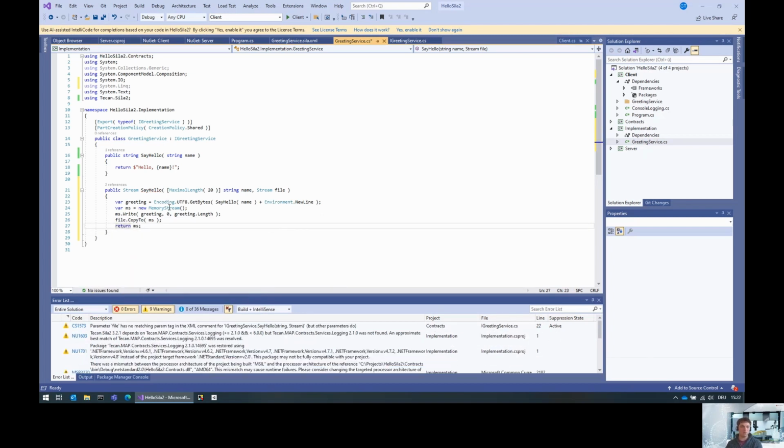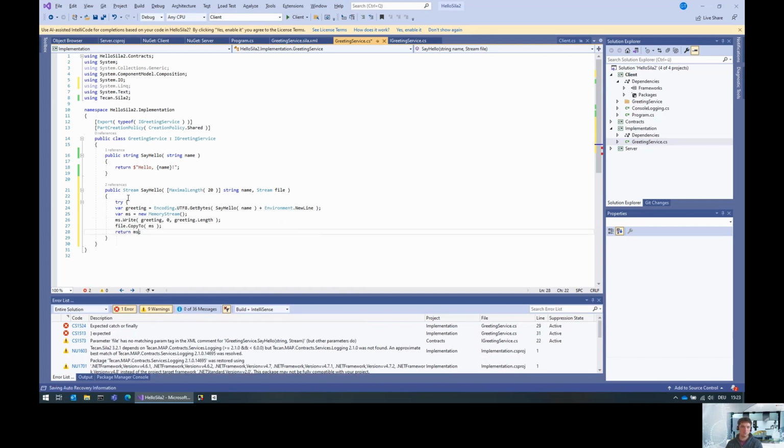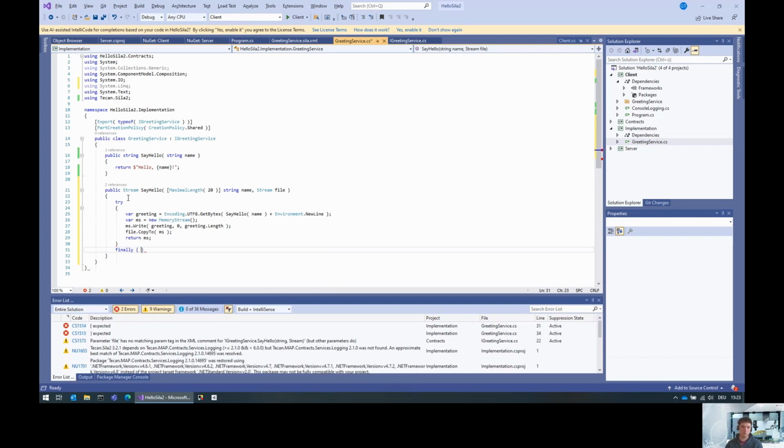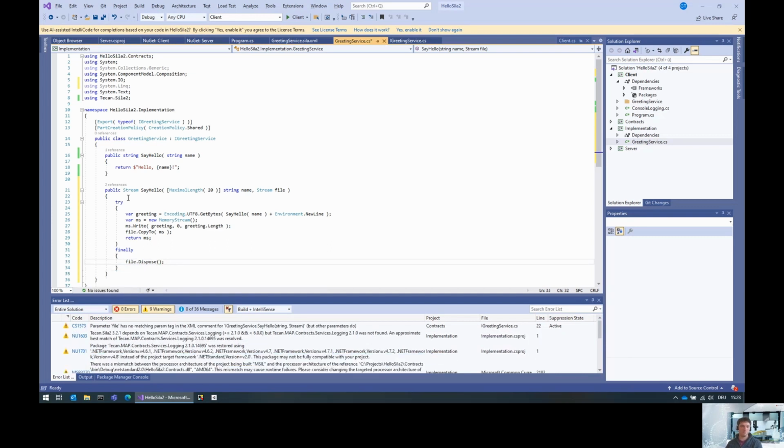Now, who is actually going to take care of this thing? And the answer is we have to do that because the SDK does not automatically clean up this file thing here. So what we need to do is we need to try this before we finally dispose the file. Okay. Implementation done.